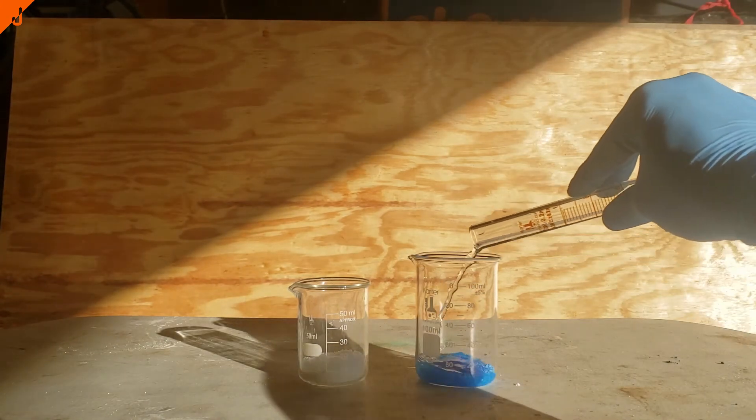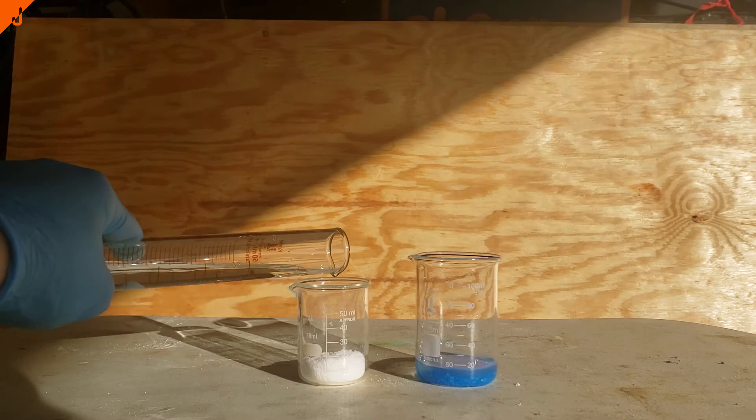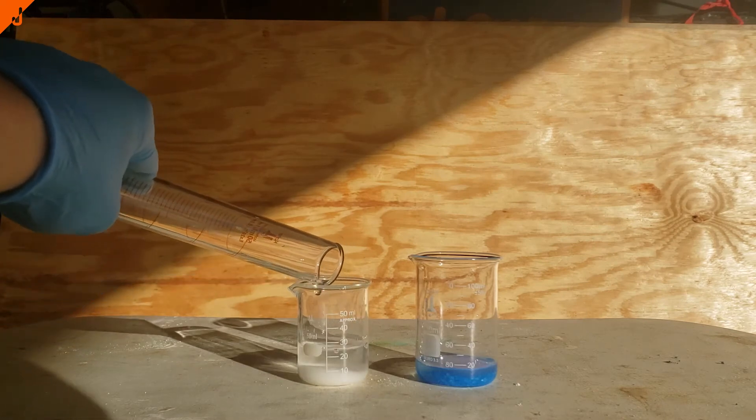However, the amount of water I added turned out to not really be enough to dissolve either, so I had to add much more in the end.